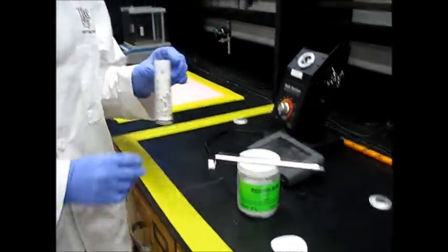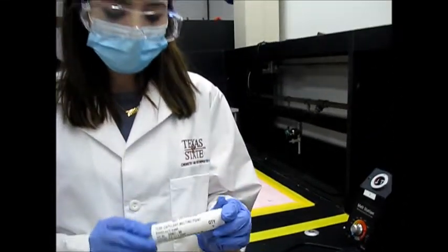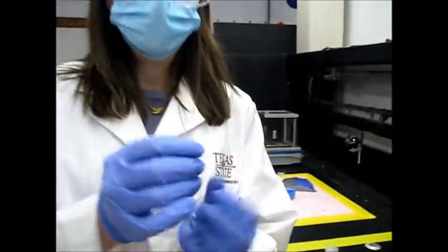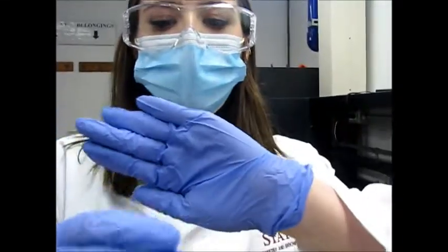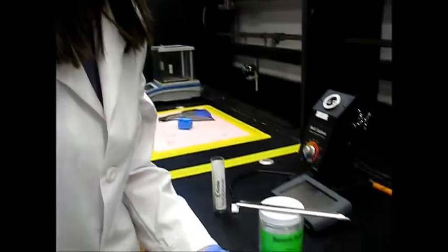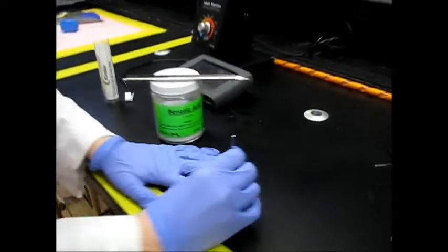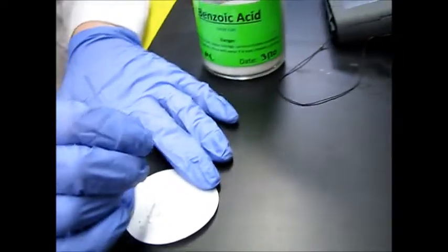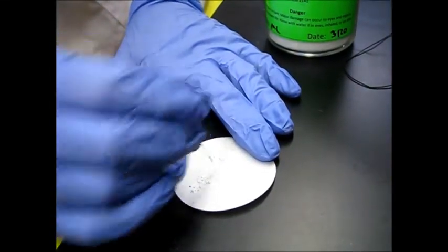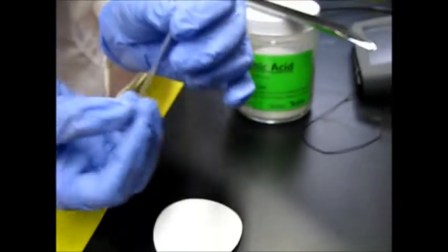The first thing you're going to do is get a capillary tube. These are tiny little glass tubes with an open end and a closed end. Basically, you take the open end and your product, once it's been out of the oven, and you pack it by tapping the product in. Then you get a pretty good amount.